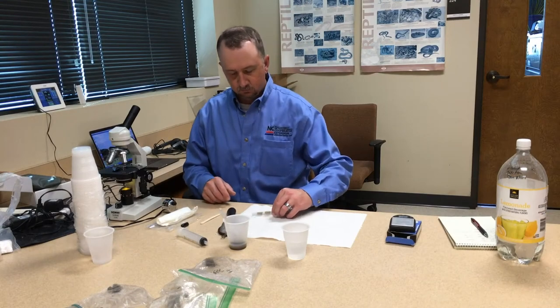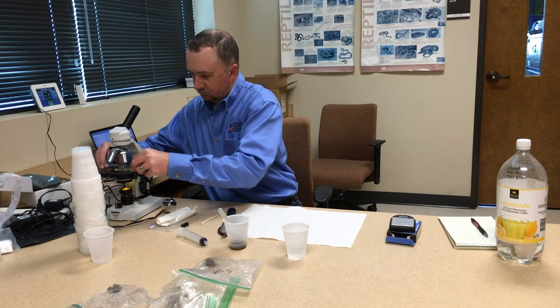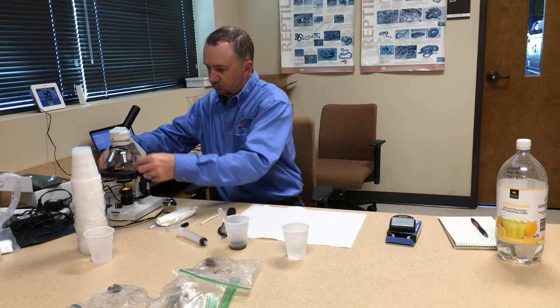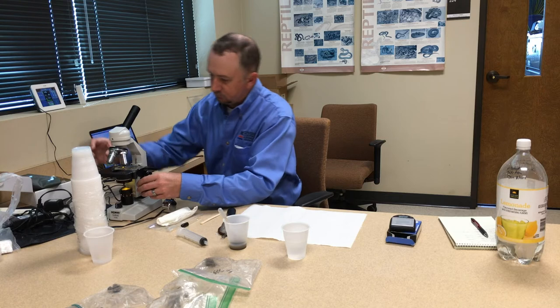Now you'll transfer your slide onto your mechanical stage. Set your microscope power to 100x magnification and adjust your focus.